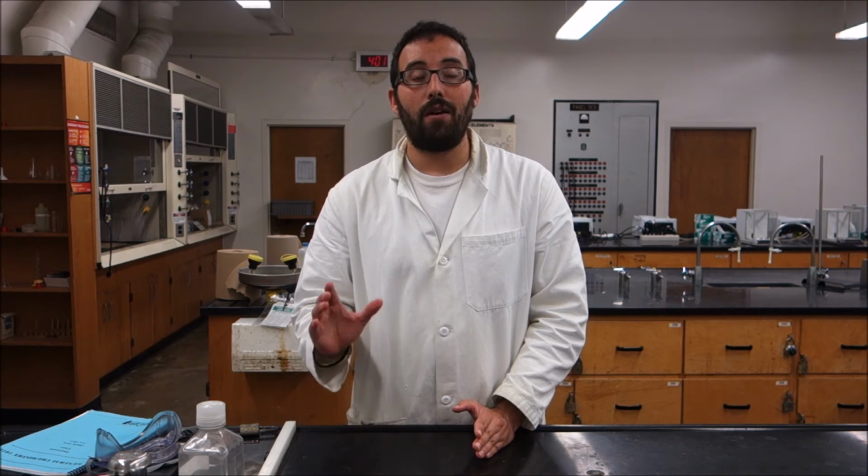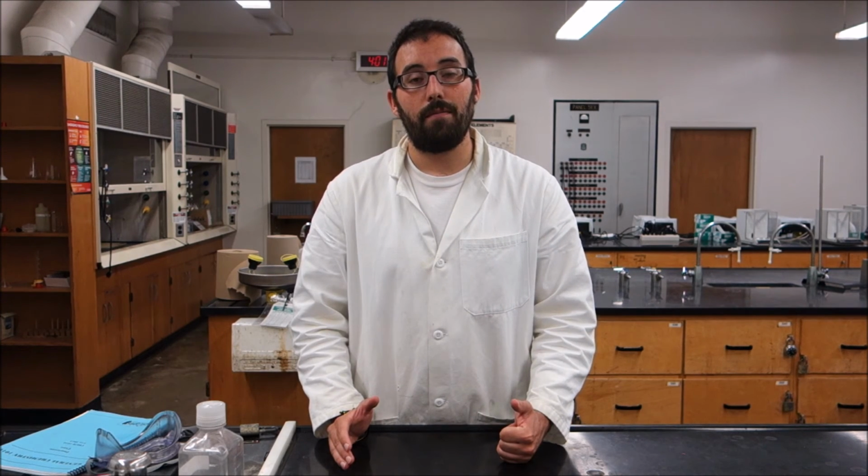You're going to take those values to figure out the wavelengths of hydrogen. And then you're going to compare them to the theoretical wavelengths that can be found using the Balmer-Rydberg equation. So that's essentially the breakdown of how you're going to be doing your lab.